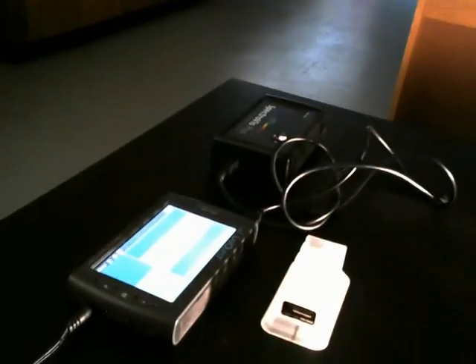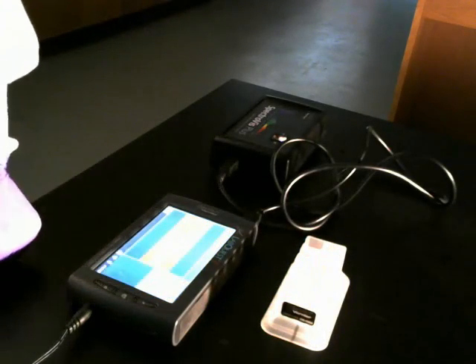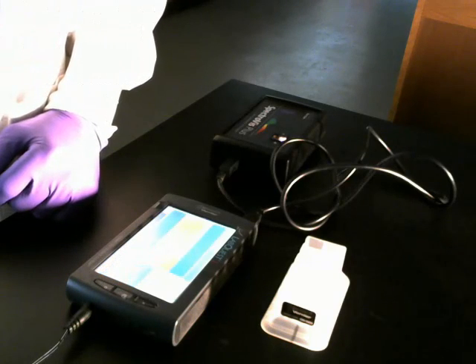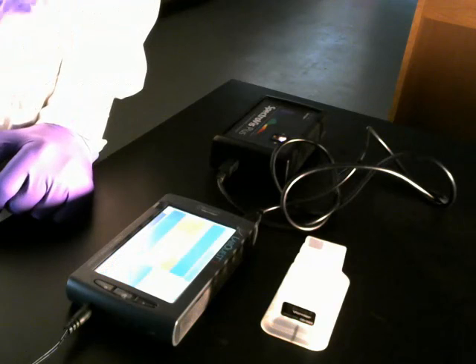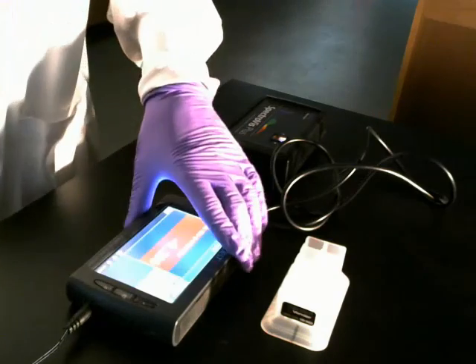Okay, so now that you see how this is all working, I'm going to go ahead and stop the recording and go through this the rest of the way on my own, collect the data, and I will make that data available to you. If you chose to do colors, let me know, and I have a data set that I can give you to analyze for your lab report based on colors. So just let me know what you want to do, and I will have a data set available for you.